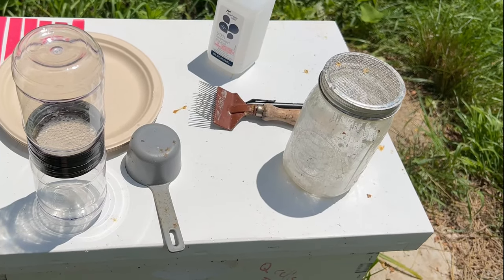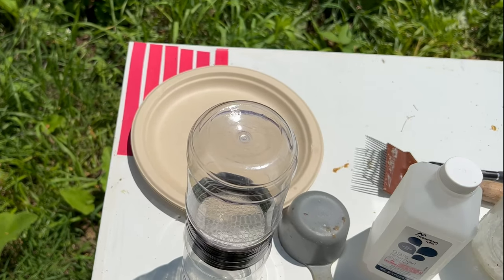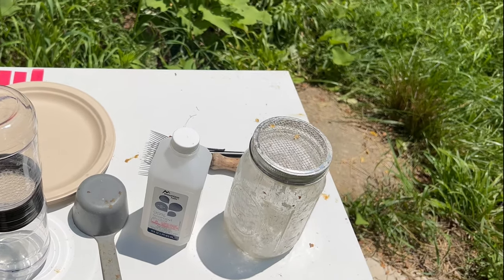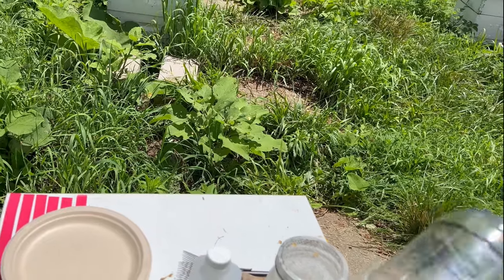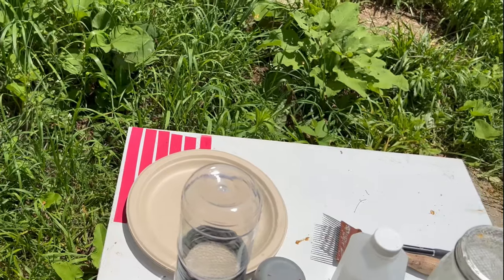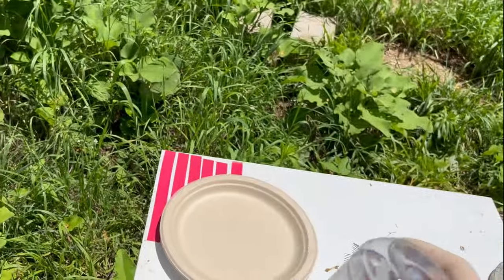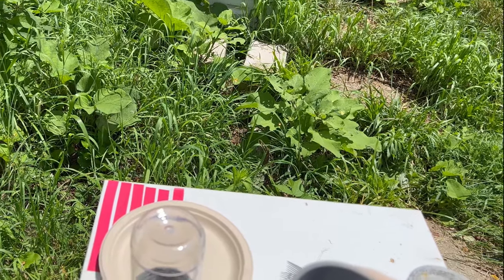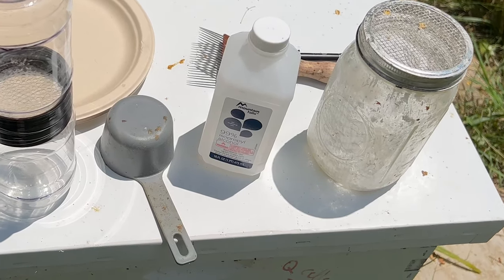I am going to be using the alcohol wash testing method for varroa. You can also use powdered sugar or a low-foaming soap such as an automotive windshield washer fluid. I've used just a couple of old food jars. You'll notice I put a mark on where the half-cup measure is — a half-cup measure is just about 300 bees.